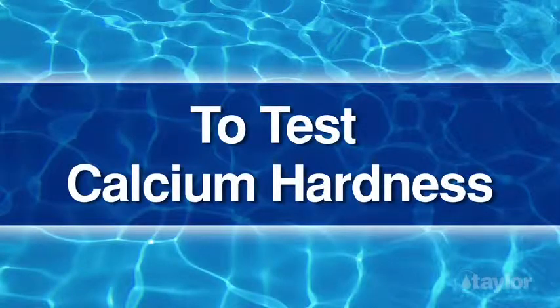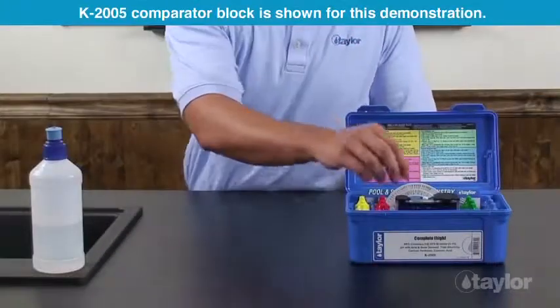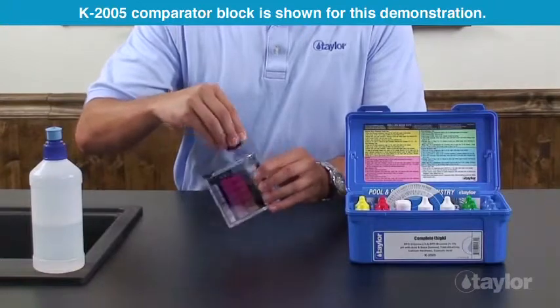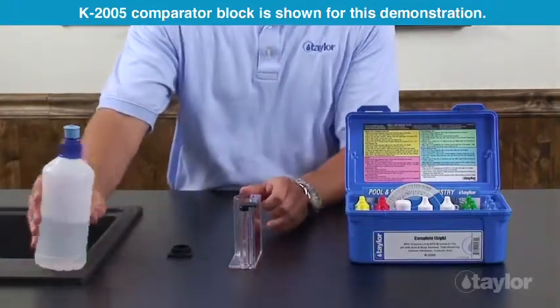To test calcium hardness, rinse and fill the large comparator tube to the 25 ml mark with the water to be tested.